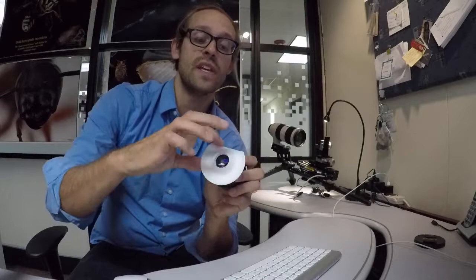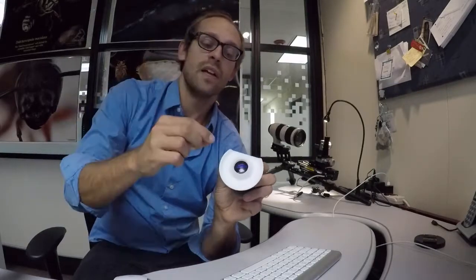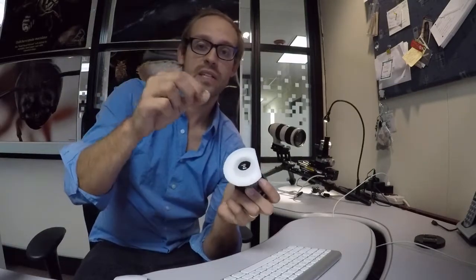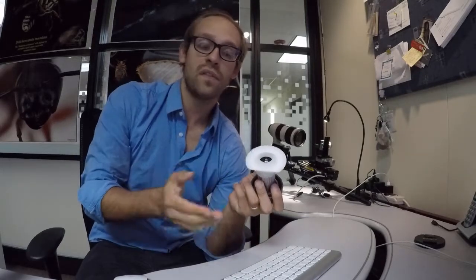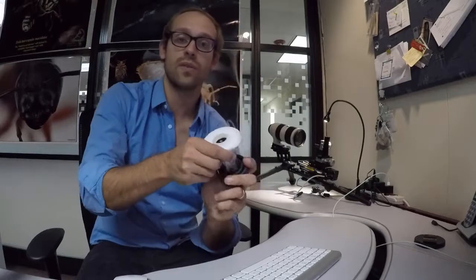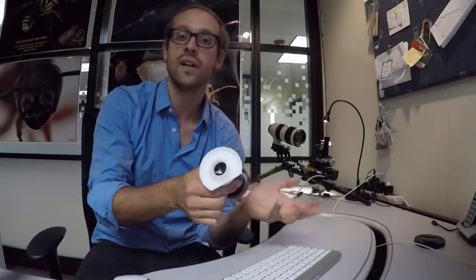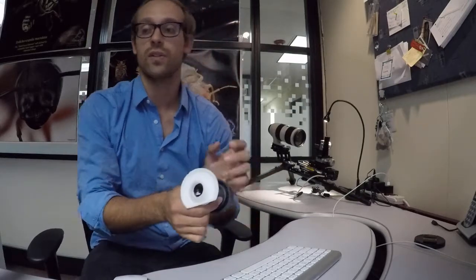Remember one of the edges here is flattened and that's so wherever your pin is sticking out on the stage you can maneuver the pin underneath this flat edge if it sticks out or if it comes in close contact with your sample if you have a very shallow working distance.